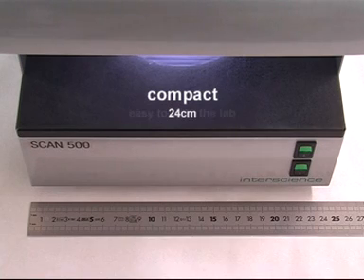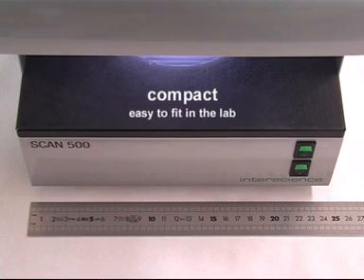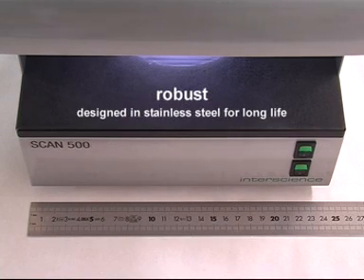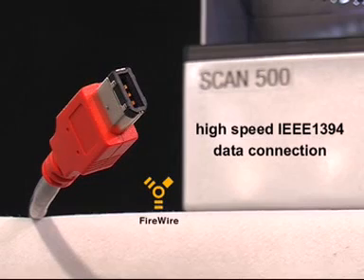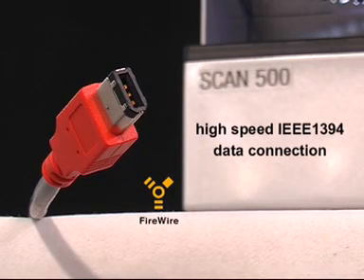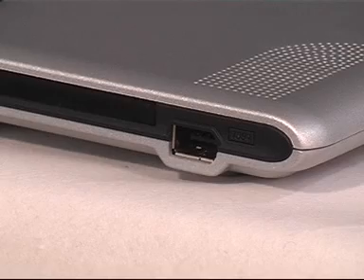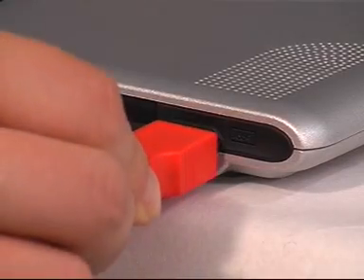Scan500 is compact and made out of stainless steel. Real-time data is possible thanks to the FireWire connection.